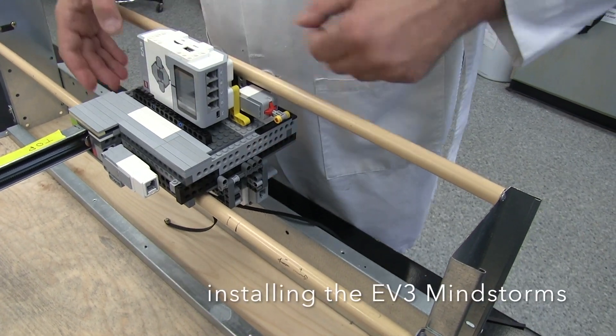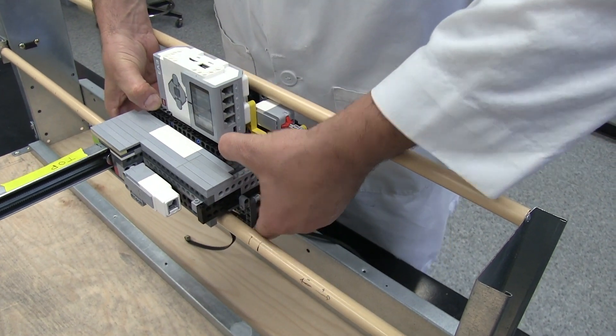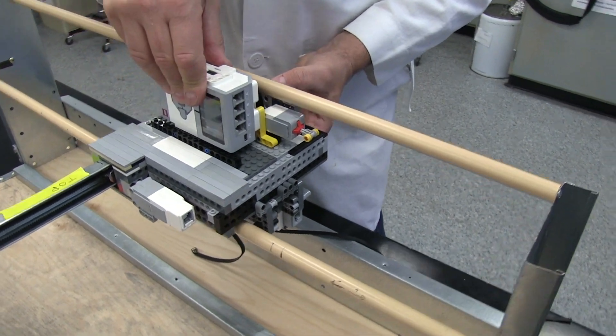At this stage, we will add the EV3 unit on top of the motor assembly unit.